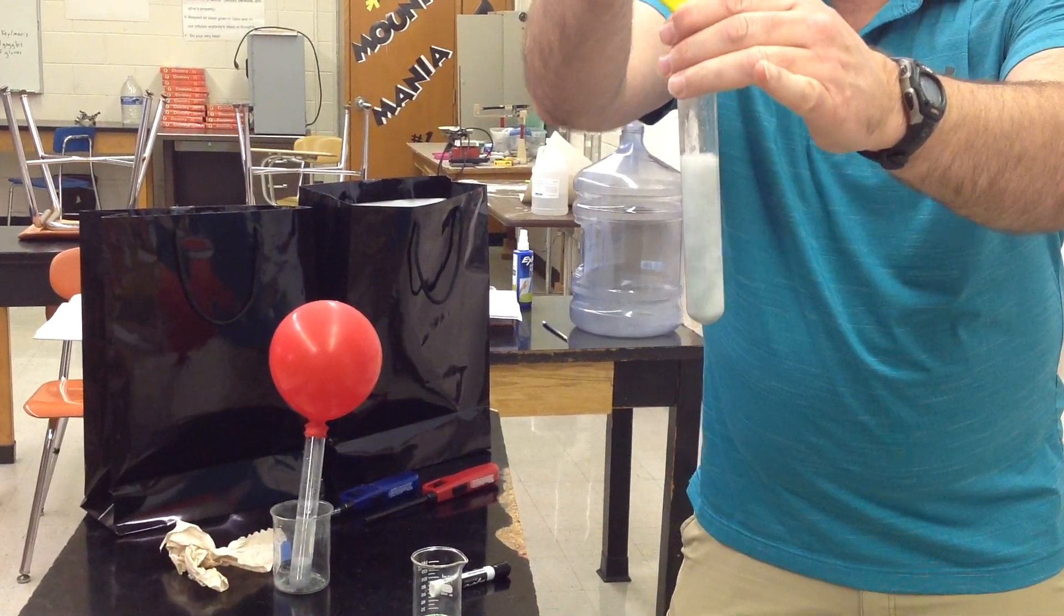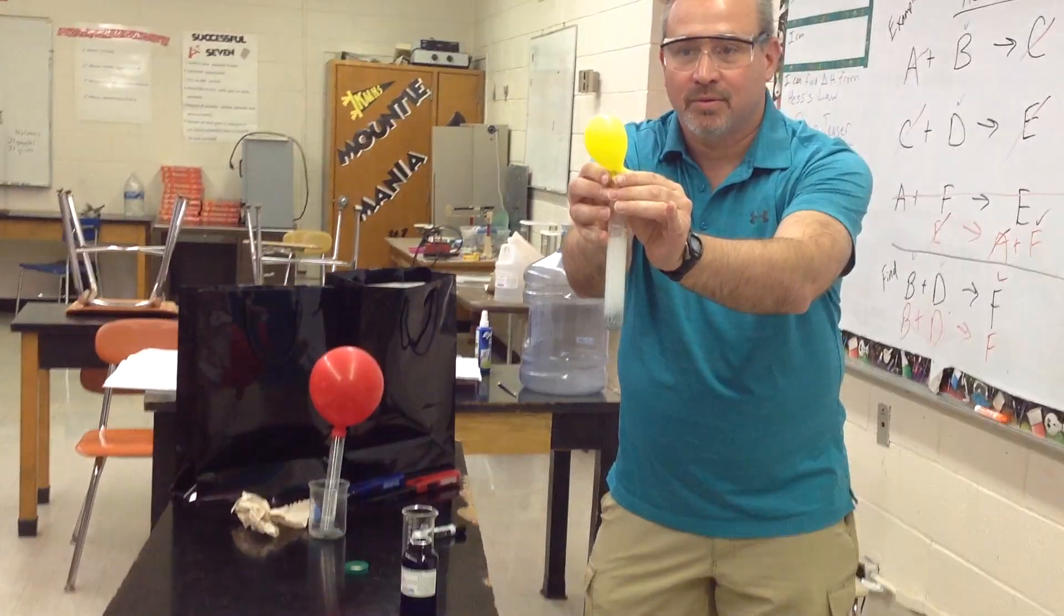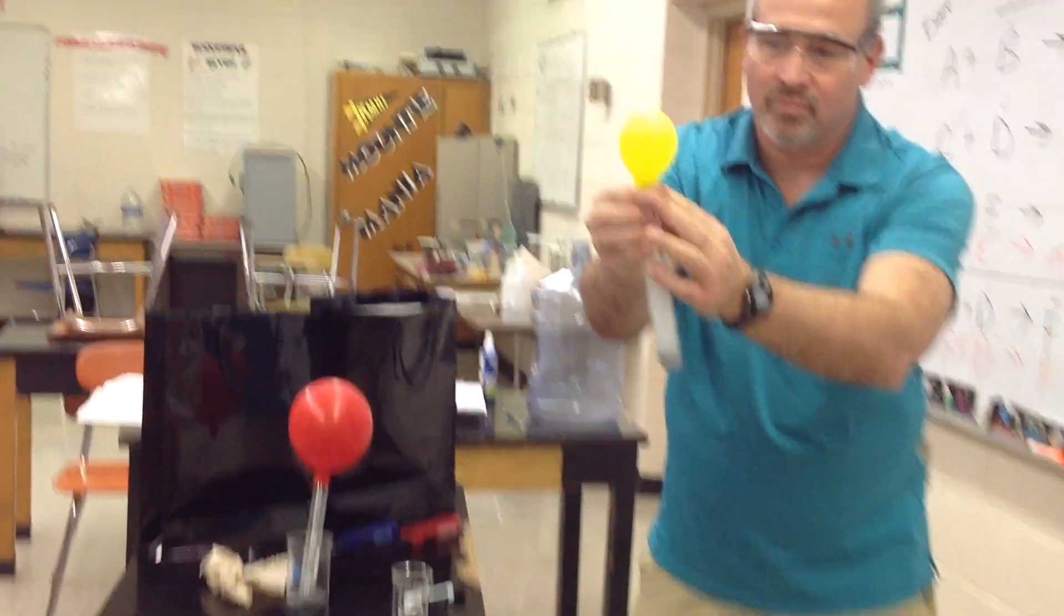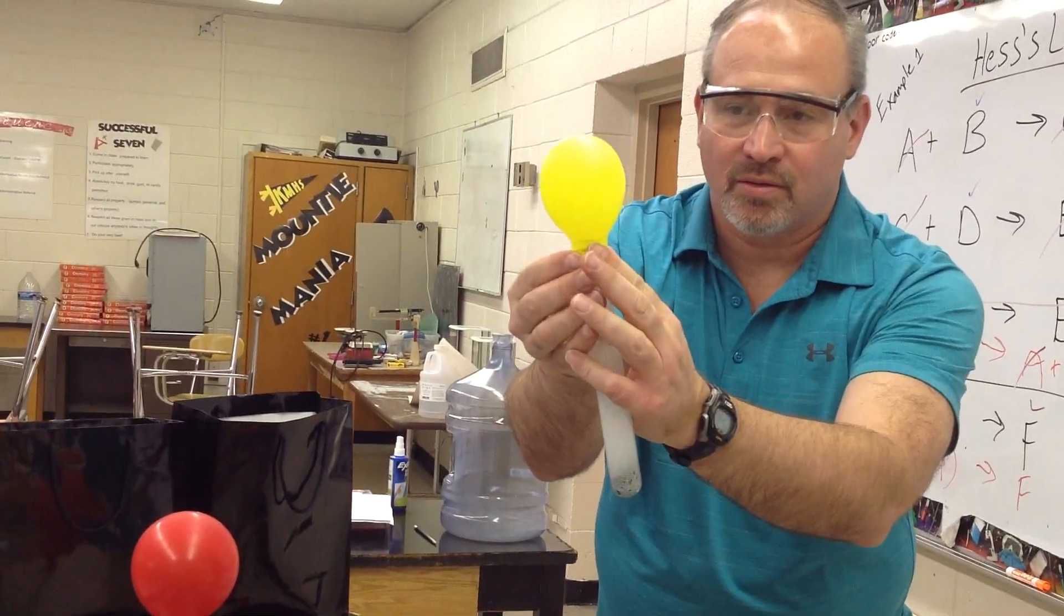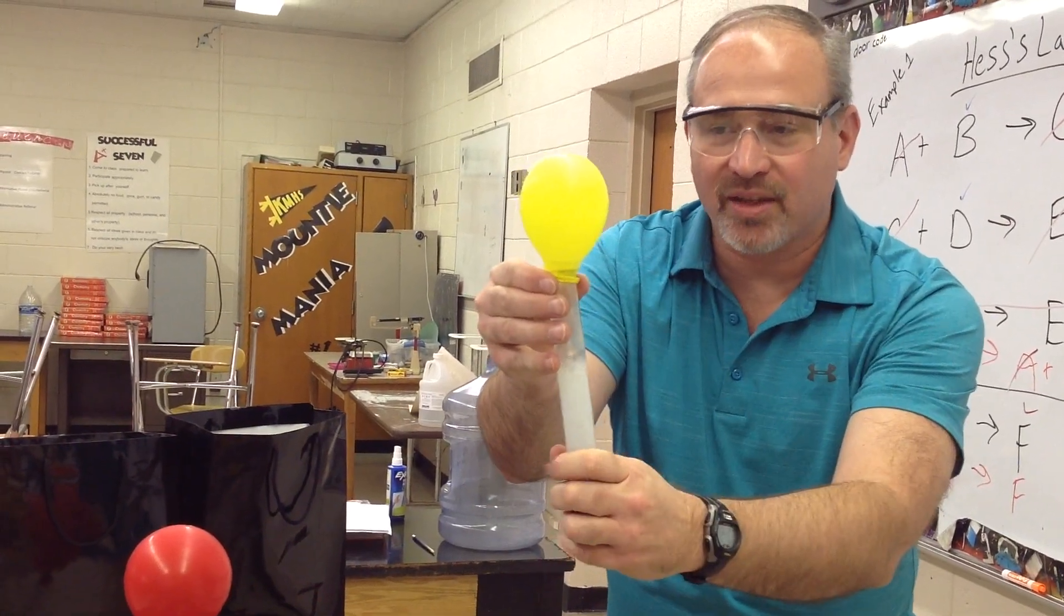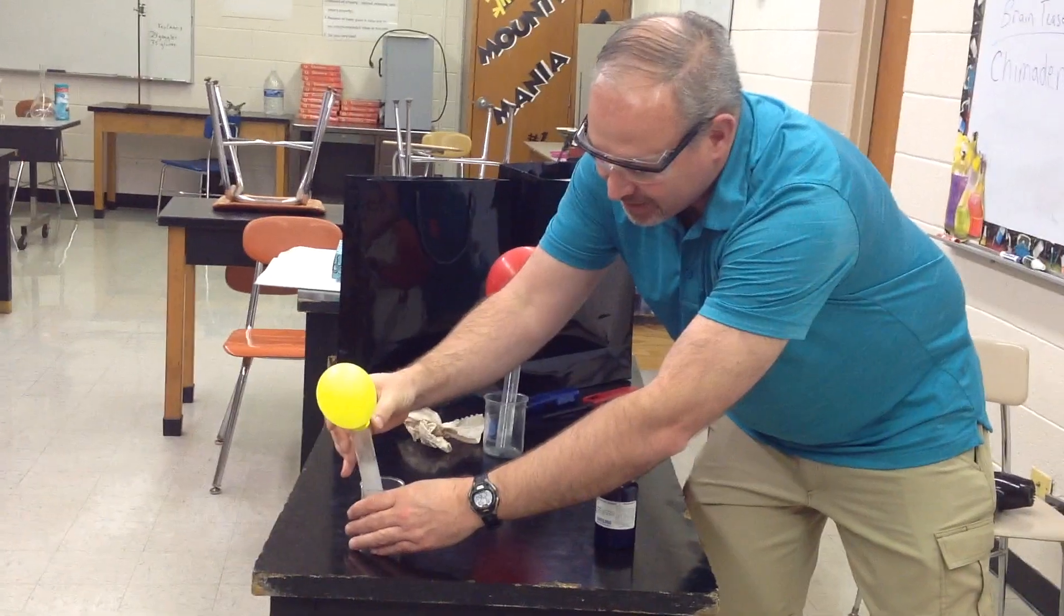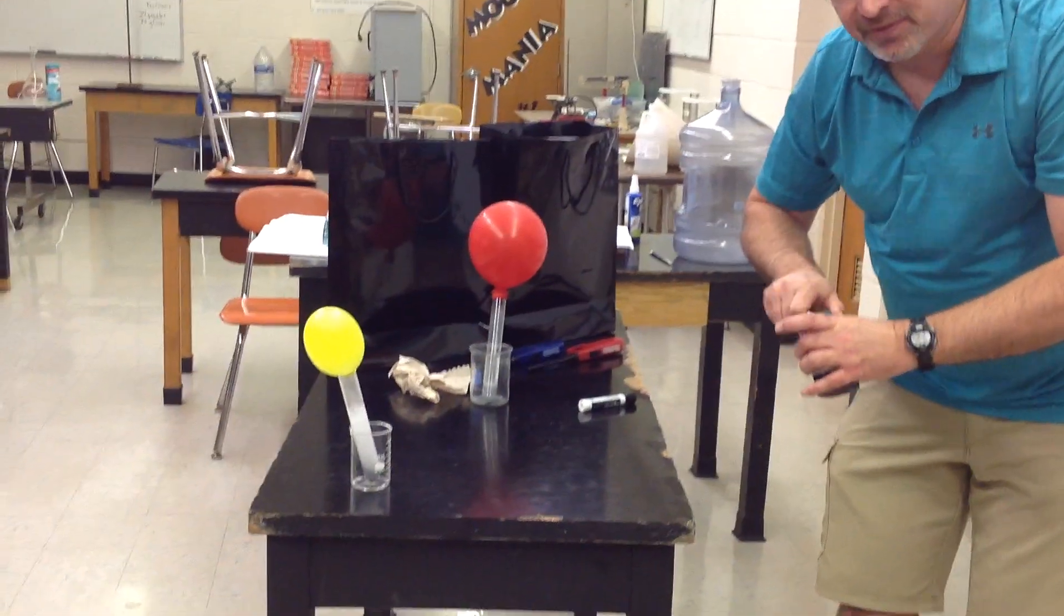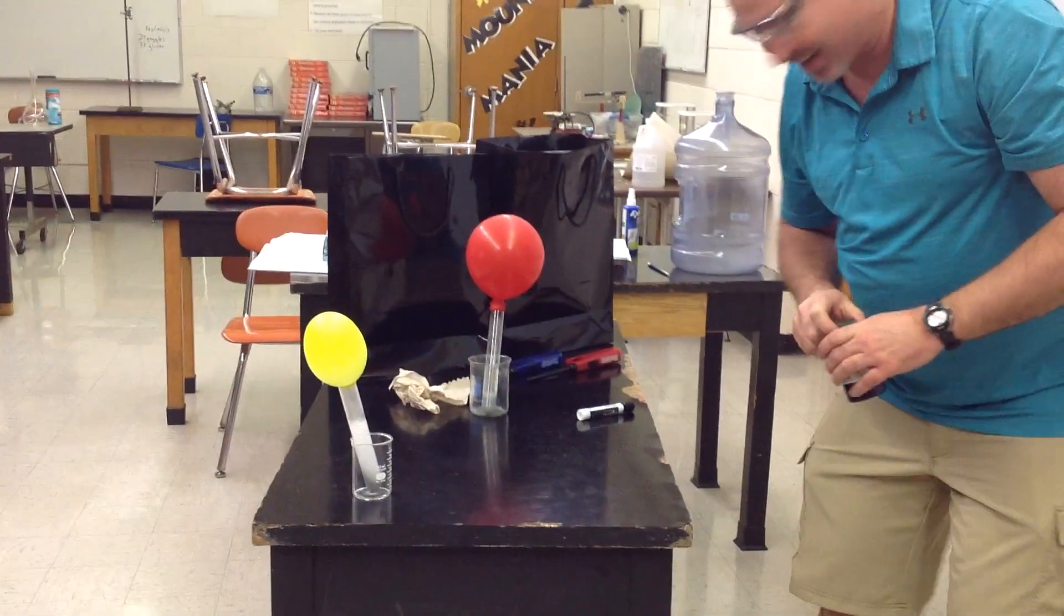As soon as we dump this in, what do you think will happen? While this one works, we happen to have one already made. So now, is the other product an explosive gas or not? There's only one way to tell, and that's to light it on fire. Let's do that.